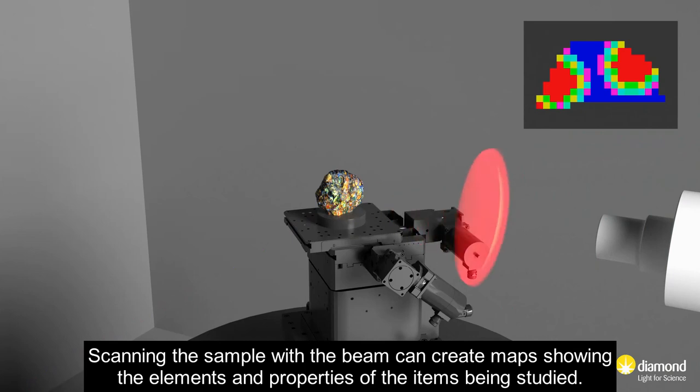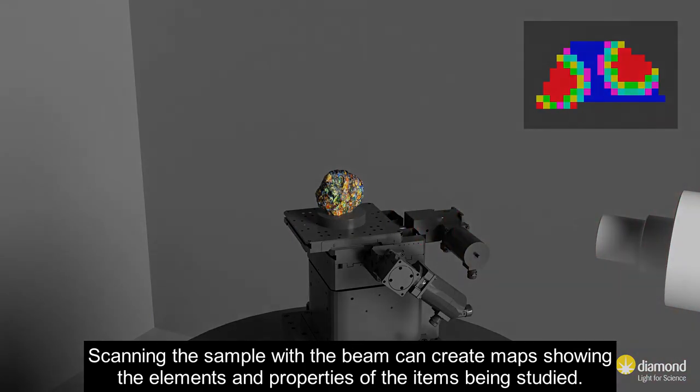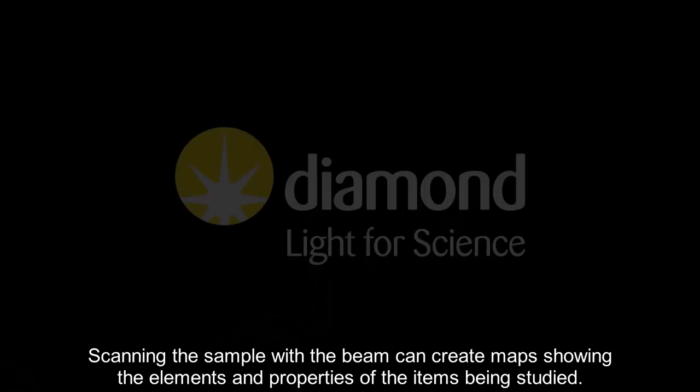Scanning the sample with the beam can create maps showing the elements and properties of the items being studied.